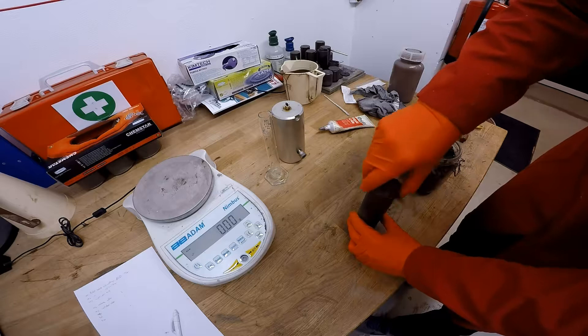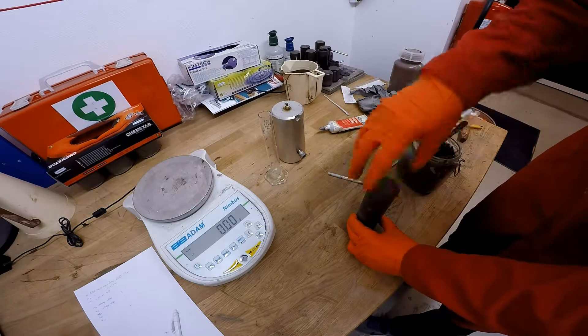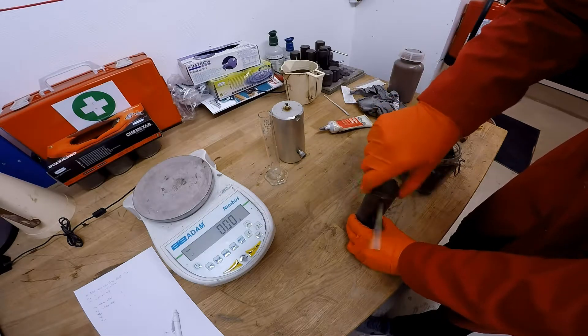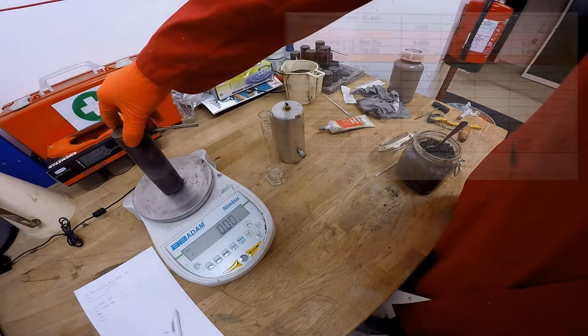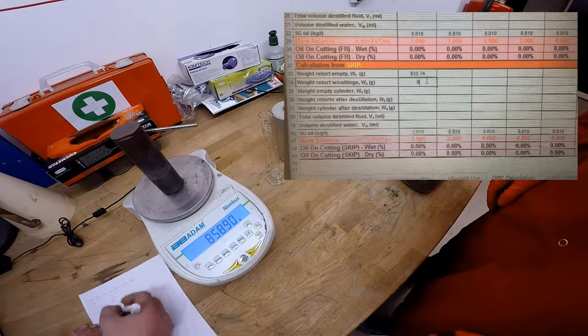Now just screw it all the way down, just hand tight, and place on the scales and take your reading. Do the same on the laptop or a bit of paper, wherever you are.